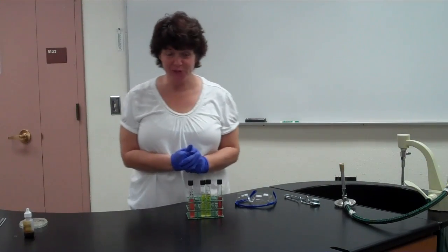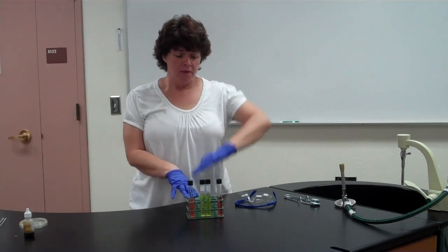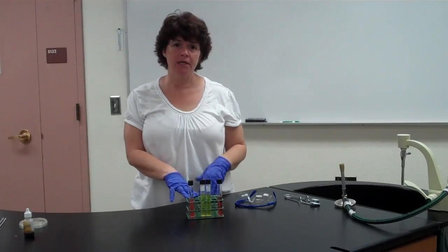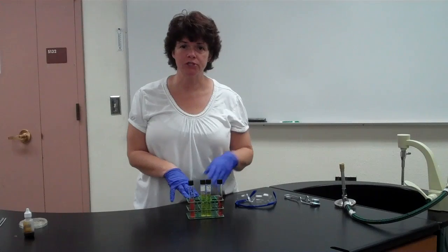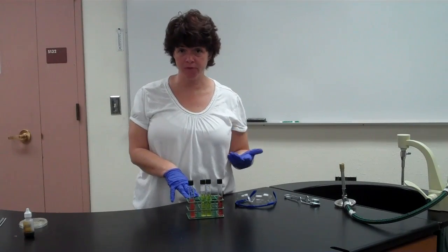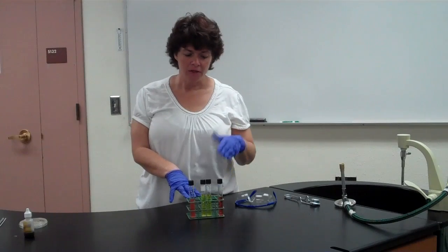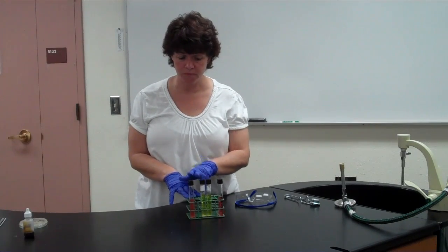Now we're going to look at the results of the carbohydrate fermentation. In the previous lab, you inoculated either the 3 or 4 tubes for the fermentation. You put 1 bacteria into each type of sugar. You did the 9 or the 12, okay? You had 4 bacteria or 3 bacteria that you put into 3 types of tubes, okay?